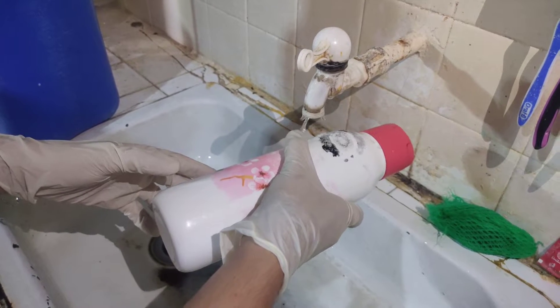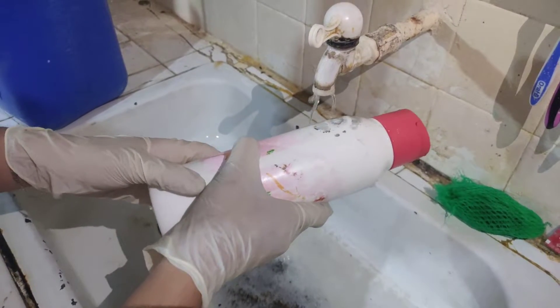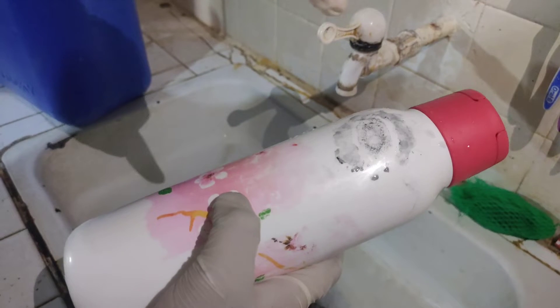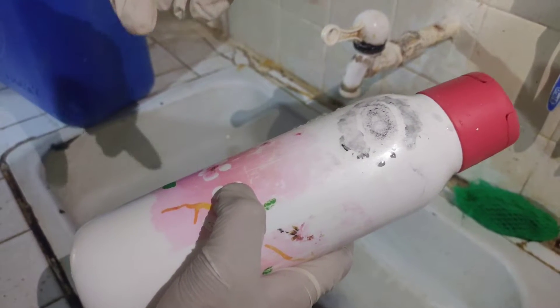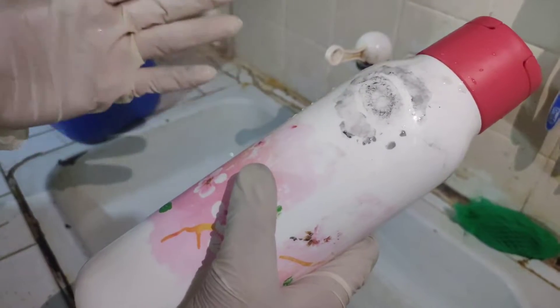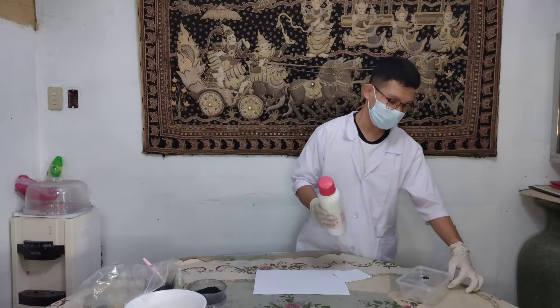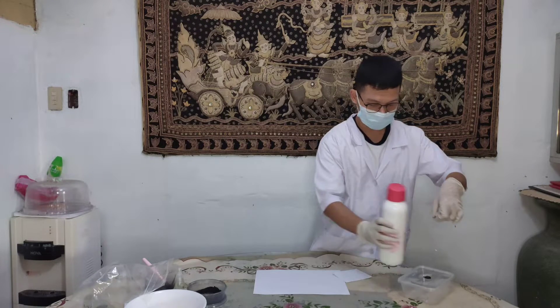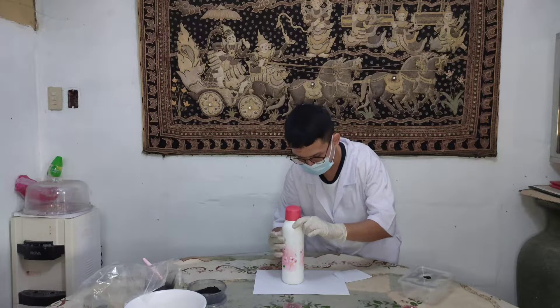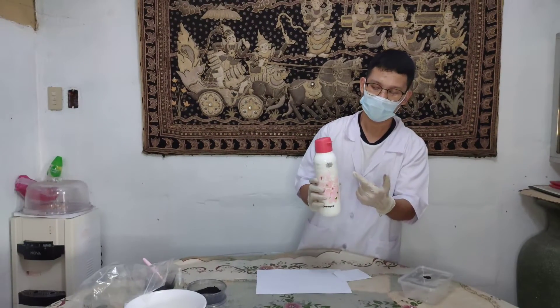We should prevent the running water from directly hitting the fingerprint. And as you can see, there's a fingerprint right here. This will be the fingerprint impression that will be used. After this, dry it and we're going to lift the fingerprint impression by the lifting tape. After drying it off, we use the lifting tape in order to obtain the fingerprint impression. This is the fingerprint impression that we got.